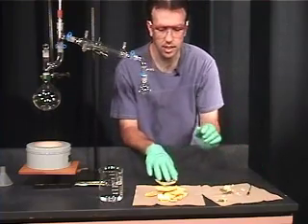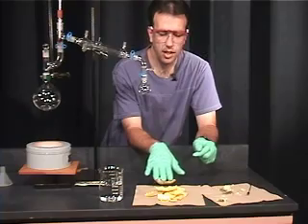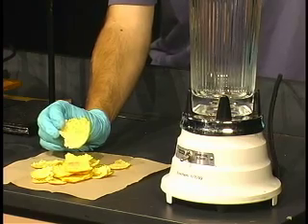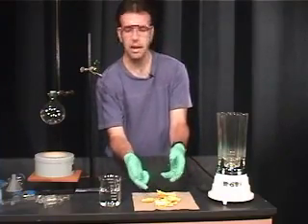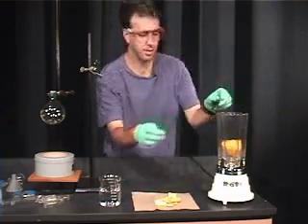I've already completed the rest of the two medium oranges and we now have to add this to the blender. Once you have removed the white pith from your two medium oranges, you want to add this to the blender. The blender is going to do most of the job of grinding this, so it doesn't really matter the size of the orange peel. We can add this into our blender.